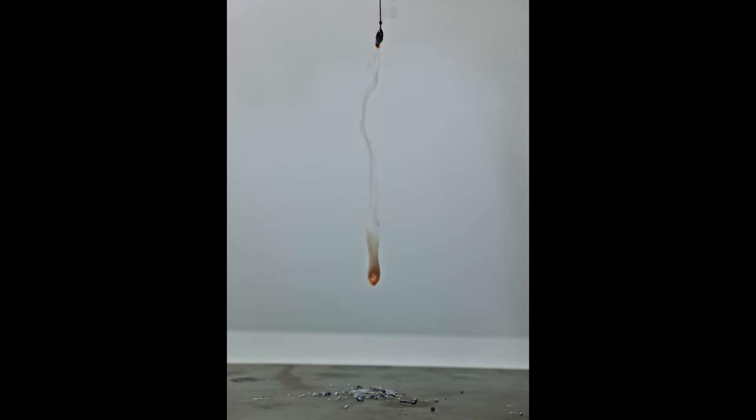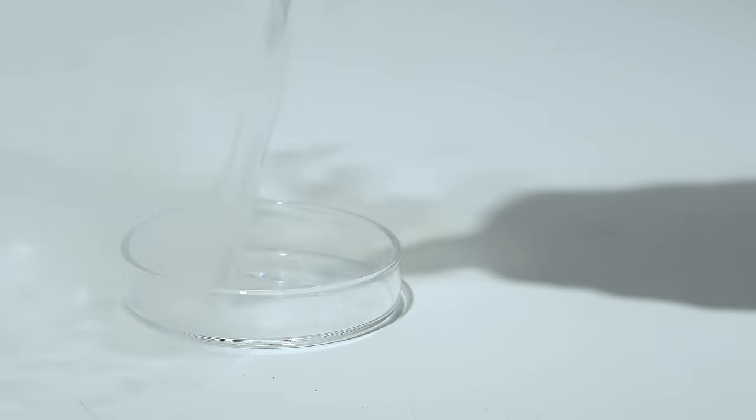In truth, the reactions of this alloy are not very different from those of the rubidium-cesium alloy in my previous video, so this time I included fewer reactions in this video.